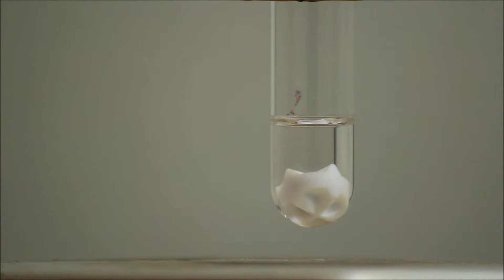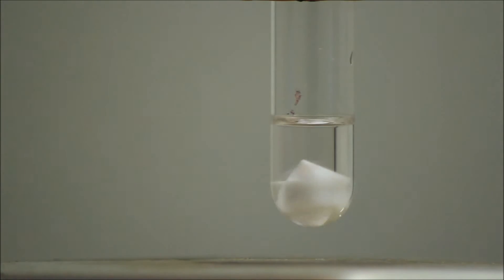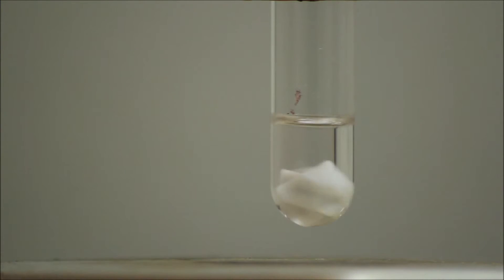As you can see, this is a microscale experiment. I don't have much more cinnamaldehyde than the amount I am using, that's why I am doing the microscale experiment. But if you keep the ratios of the reagents you can scale it up. You can use natural cinnamon essential oil, which can be added to the test tube. The essential oil contains about 98% cinnamaldehyde.